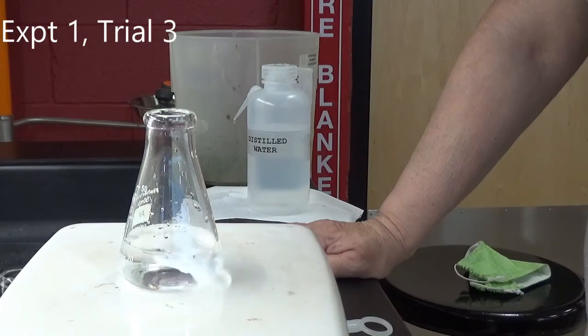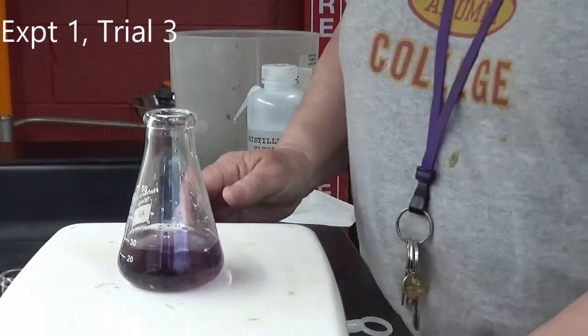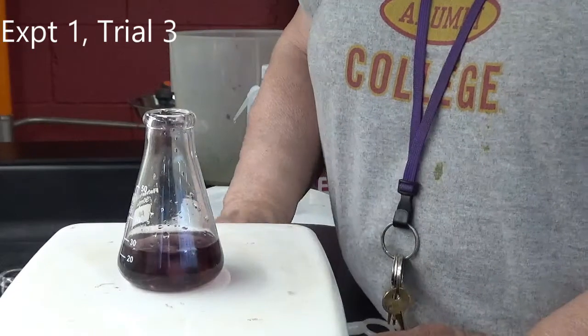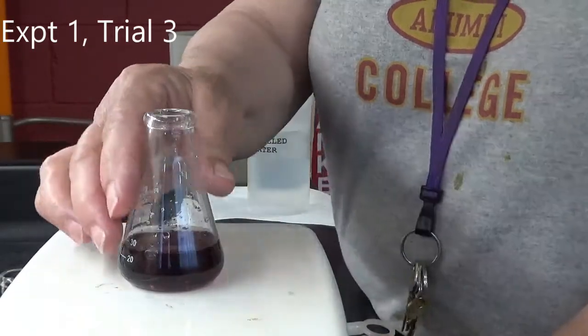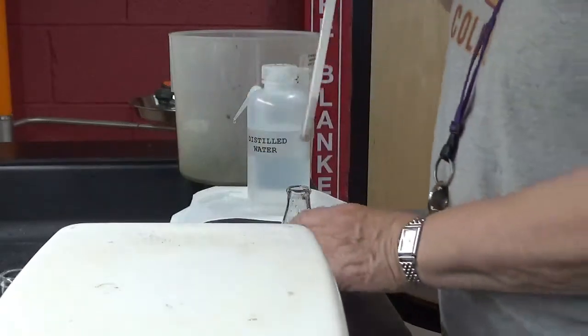Anticipation. Yep. Okay. Look at that. So, let's see what we got there. We got 32.98.